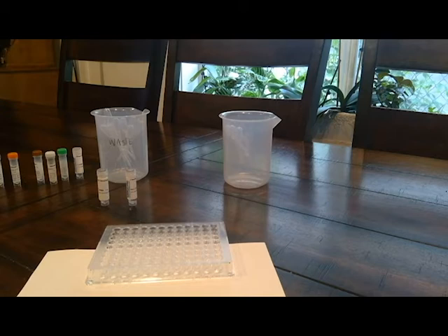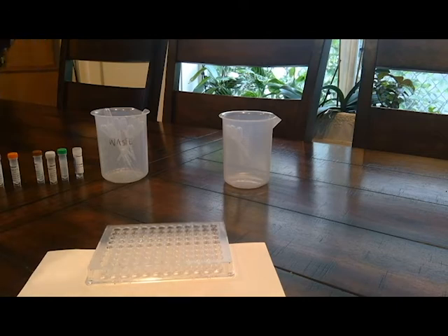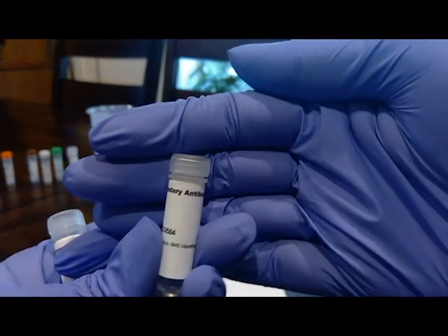All right, so now we're at step 12. Take a new pipette and without allowing the pipette to touch any of the liquid in the wells, add 3 drops of simulated secondary antibody to each well in rows A and B. So the simulated secondary, that would be this one.